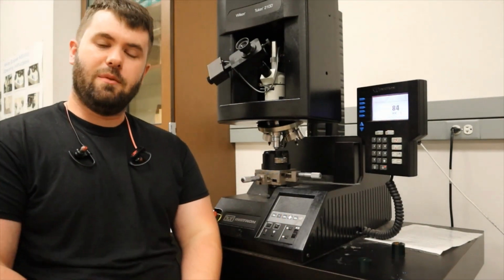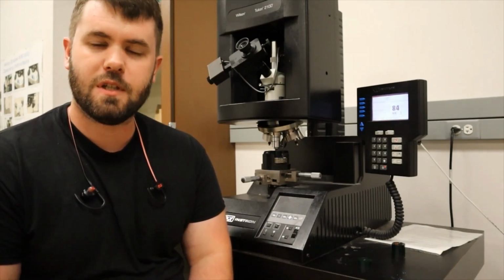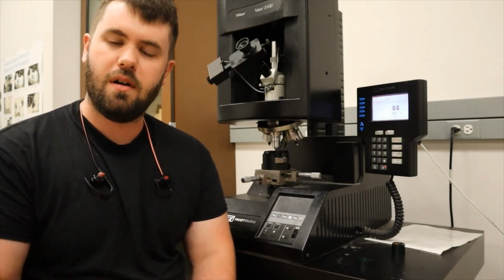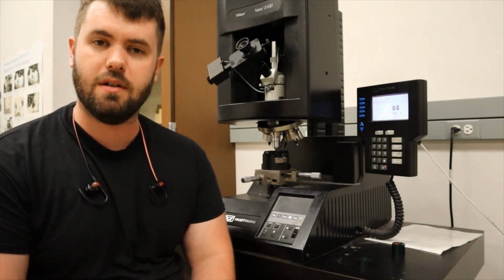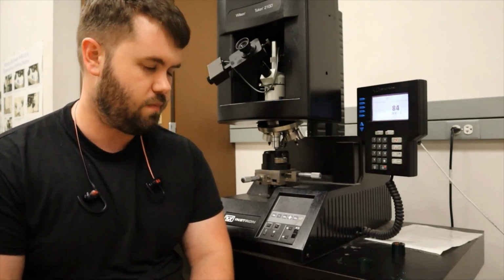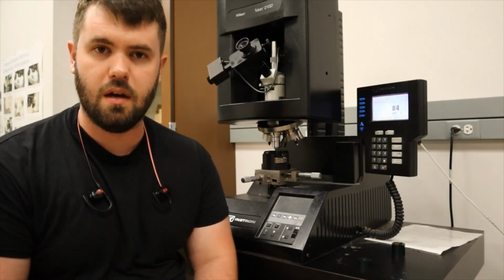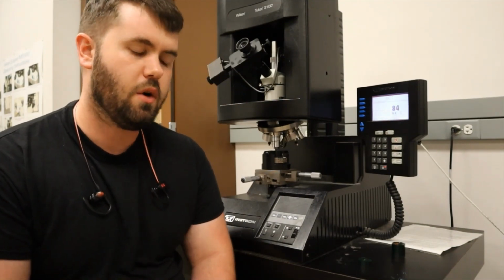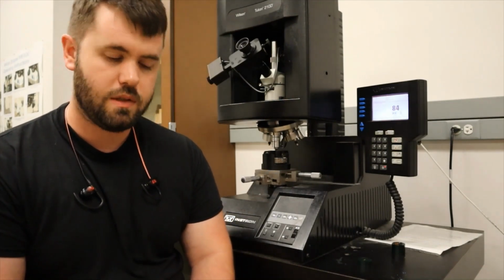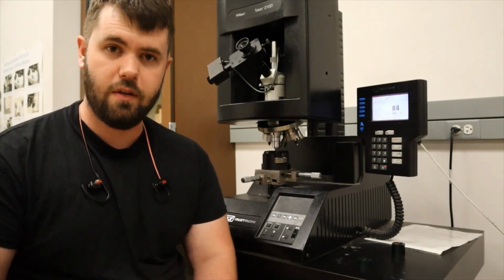And this sample is a relatively old sample. It has been used throughout the years repeatedly, so it has a lot of previous indents already in it. It's important to remember about the Rockwell test, and this applies to the microhardness test as well, that you don't want to indent close to a previous indentation, because indenting a sample cold works the sample in the immediate surrounding volume of material. So our sample is slightly harder near the area where an indent occurred. So you want to make sure that you find your indent location, and it's far away enough from other indents.